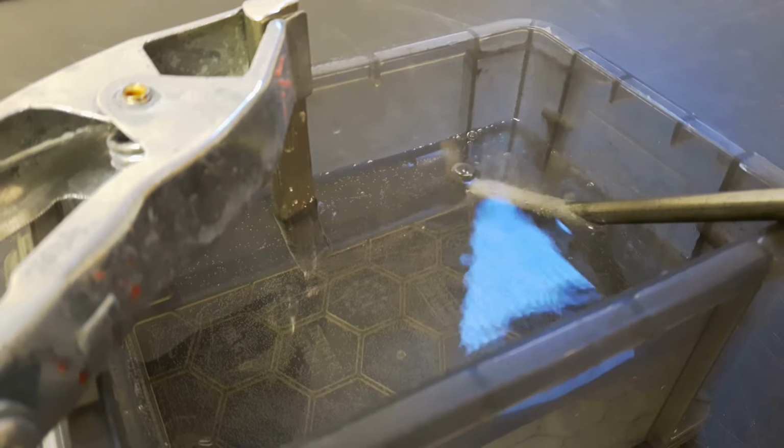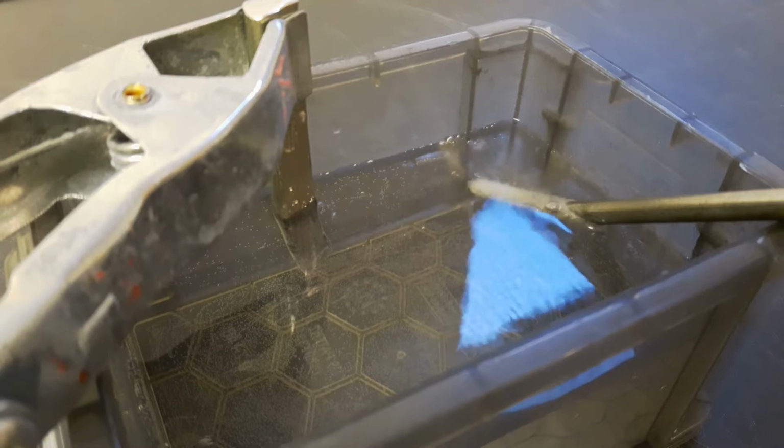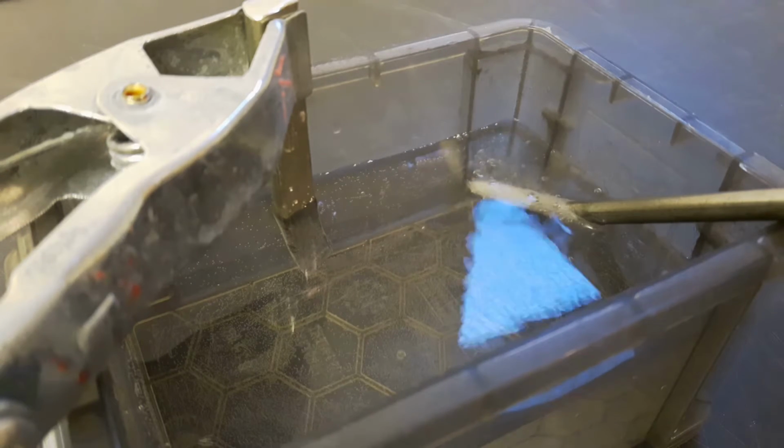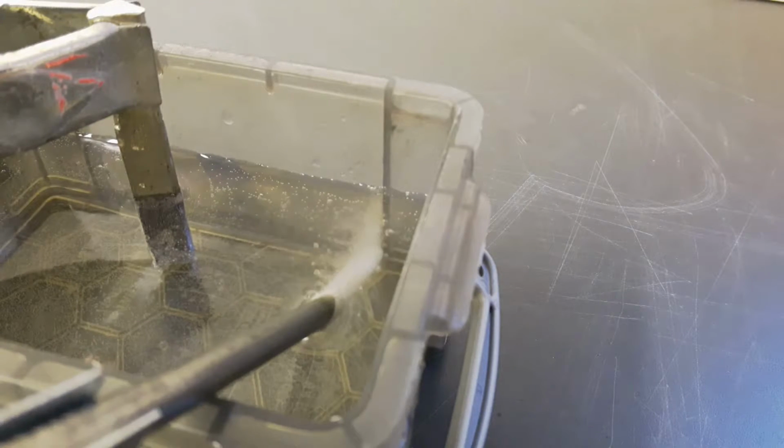Because if we would electrorefine, the tin would be oxidized here and reduced at the iron nail, and so we would basically just purify the tin and get rid of the copper. I could do this as well, but this time I want to make stannous chloride solution, so I have to ensure that only hydrogen is produced here.